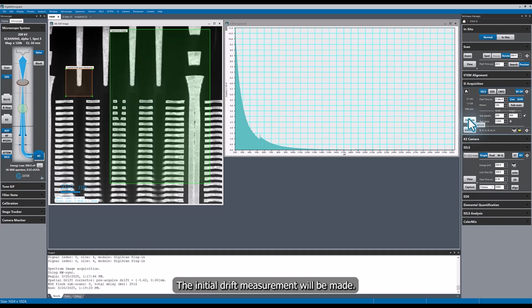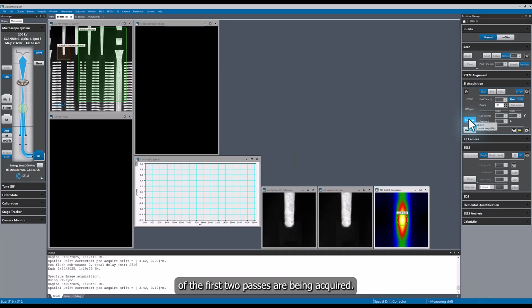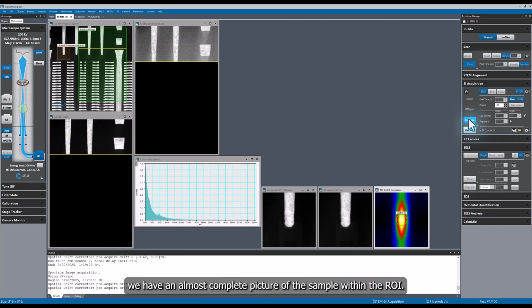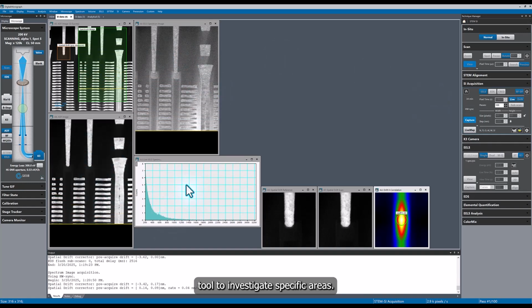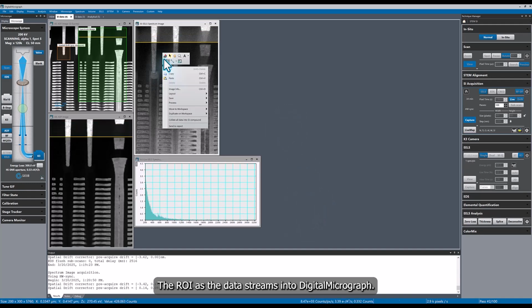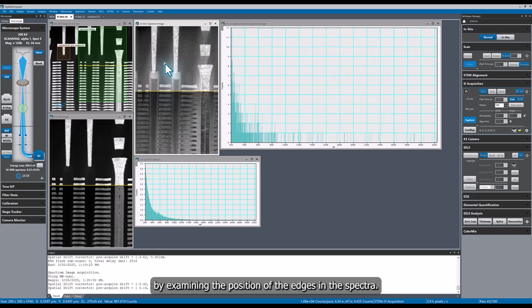First, the initial drift measurement will be made. Digital Micrograph will measure the drift rate within a 30-second window so that the drift correction can be applied while the first 2 passes are being acquired. Within a few seconds, we have an almost complete picture of the sample within the ROI. We can still use the Spectrum Picker tool to investigate specific areas of the ROI as the data streams into Digital Micrograph. I can start identifying edges in my sample by examining the position of the edges in the spectra.